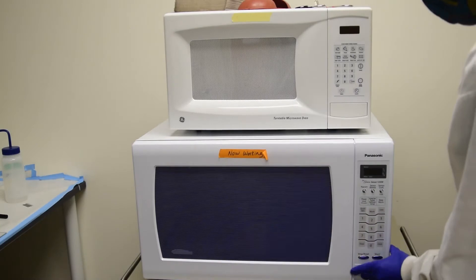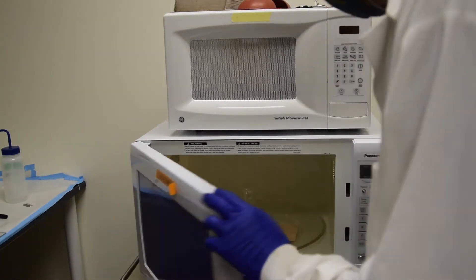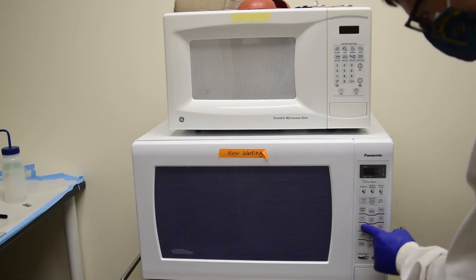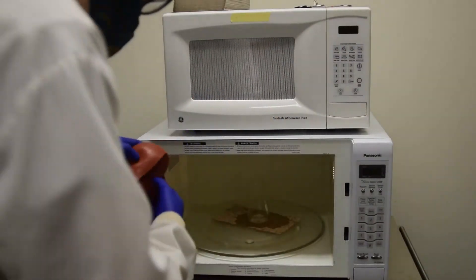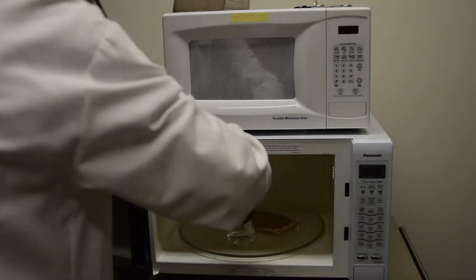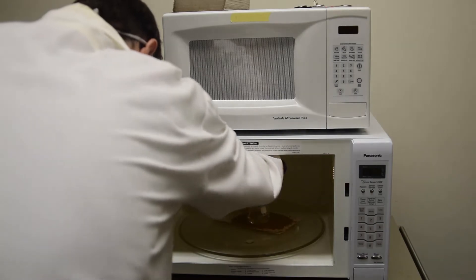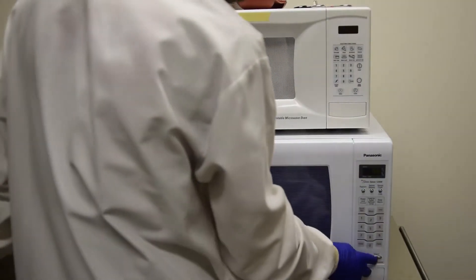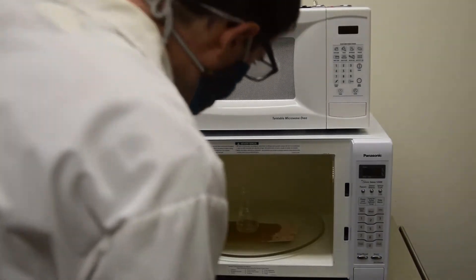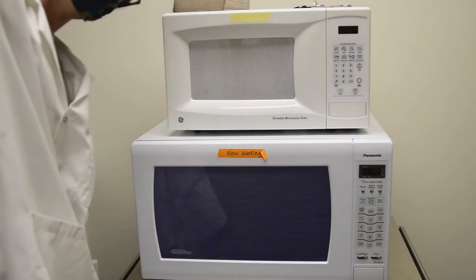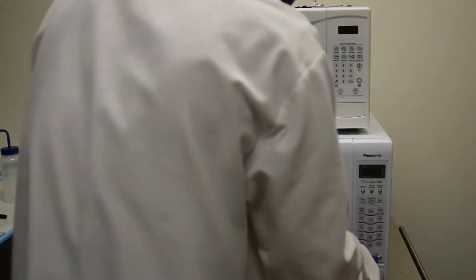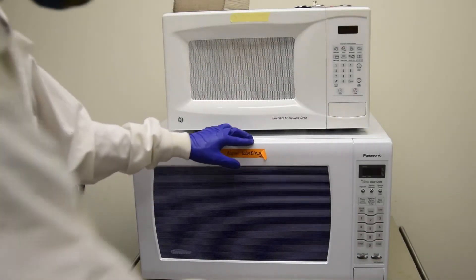Microwave the mixture for 1-2 minutes, stirring occasionally. After enough time, the mixture should have no suspended particles.